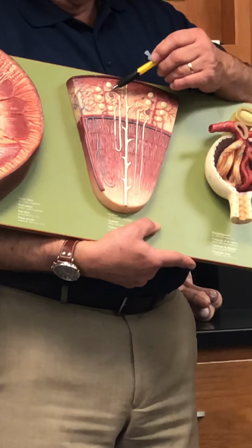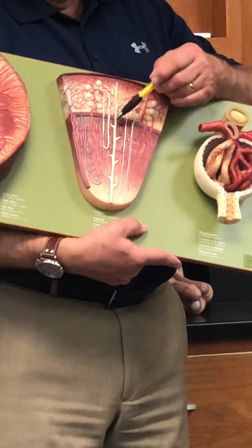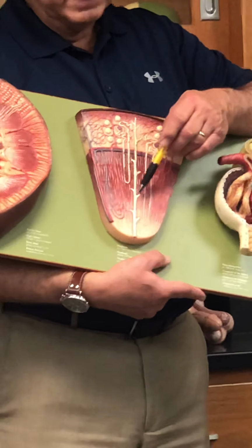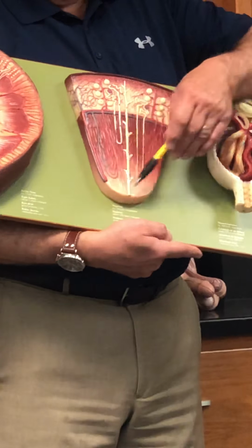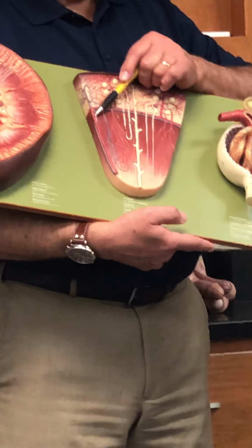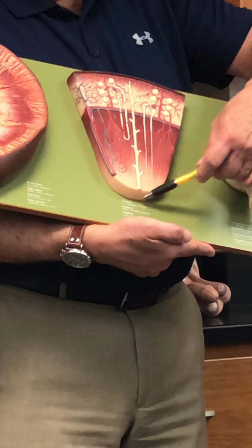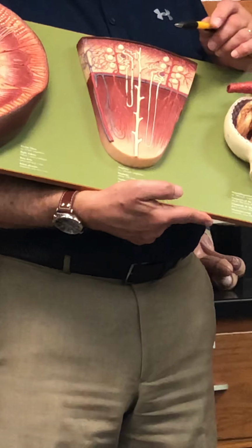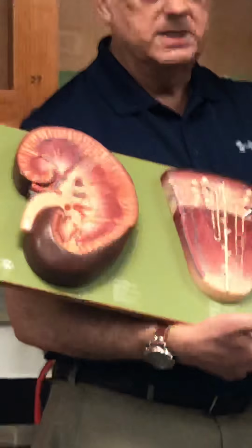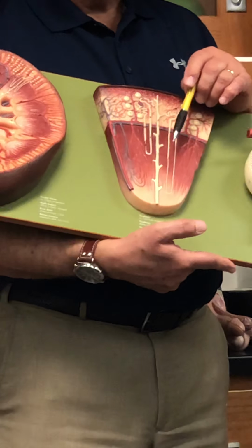You can see it's associated with the vessel, right? And then makes its way around into the collecting duct. You can see that there are many nephrons associated with this one collecting duct. Okay? You can see this is the pyramid. The striations that you see here, those are all collecting ducts for the most part. What's this section of the pyramid called? Papilla. Right, it's the papilla, which leads into the minor calyx from this point on. This is where the urine begins to drip into those capture areas.